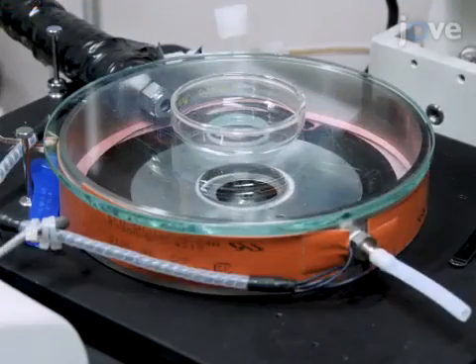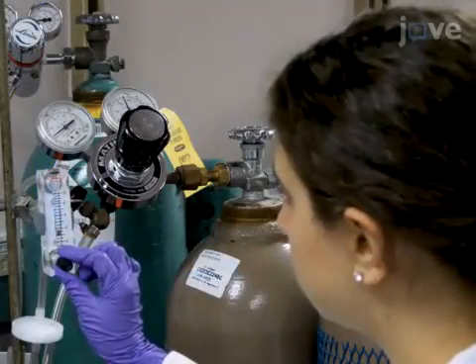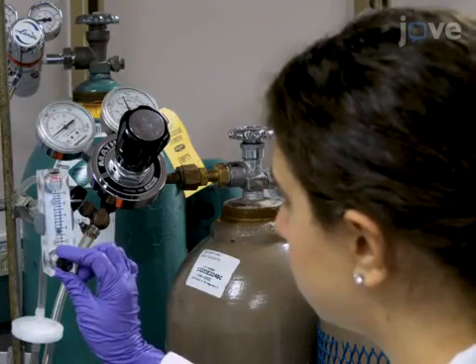Set up a stage top environmental chamber to maintain constant temperature at 37 degrees Celsius, 5% CO2 atmosphere, and greater than 95% humidity.